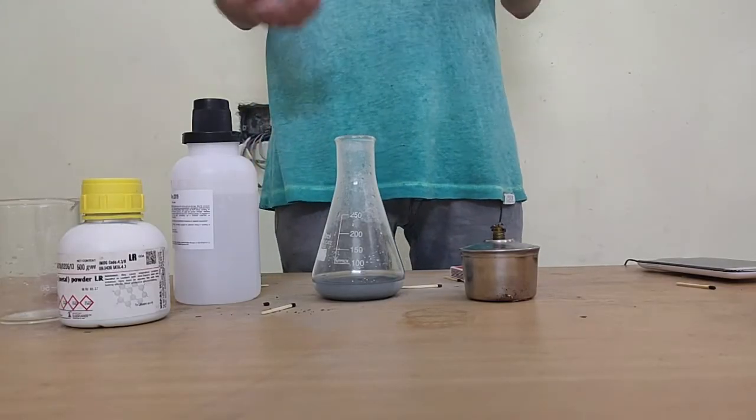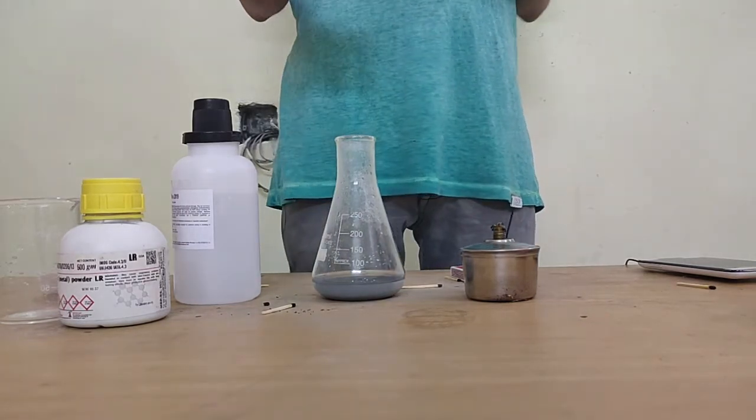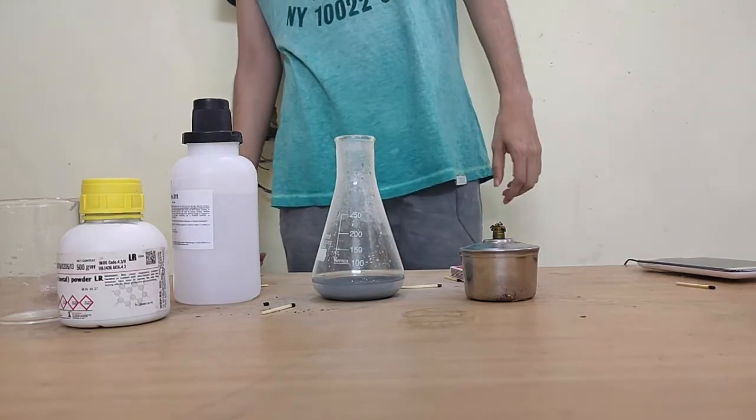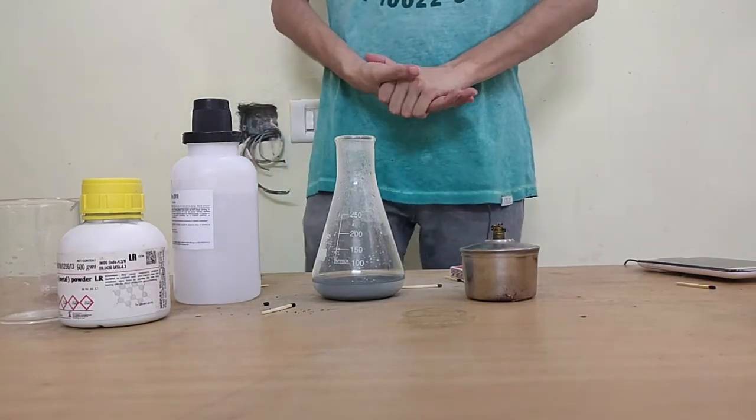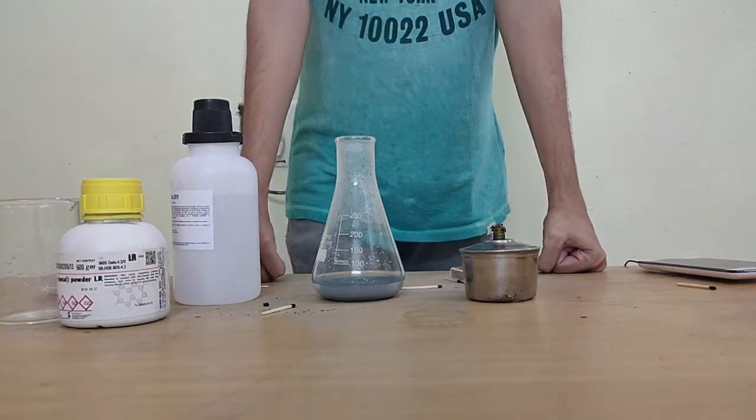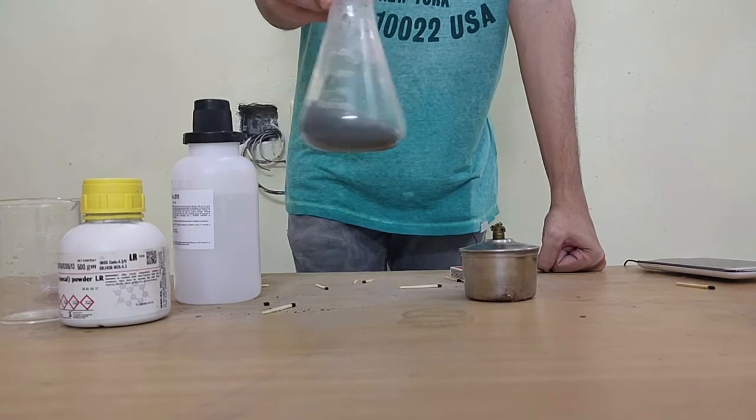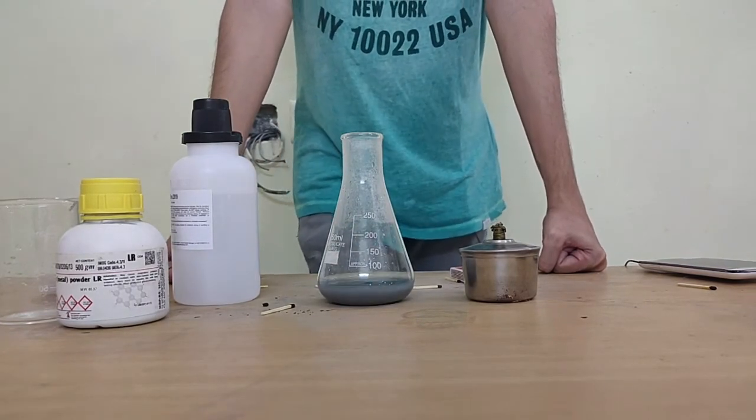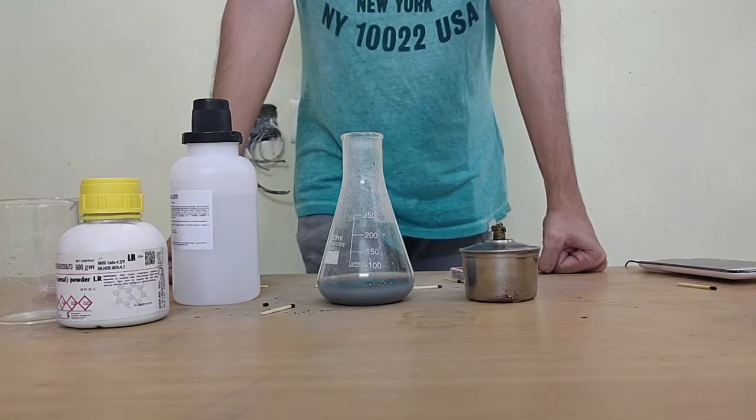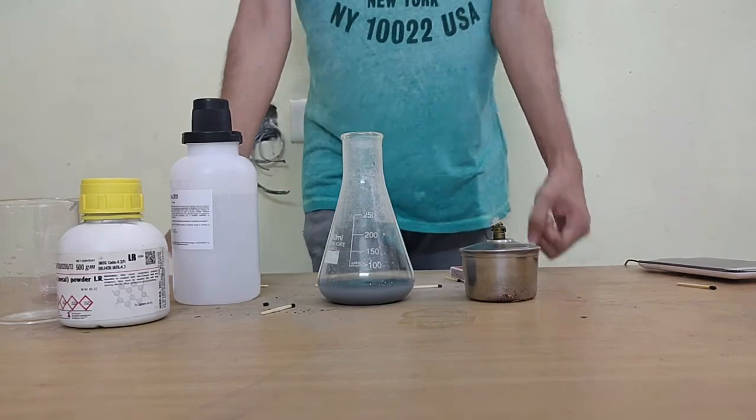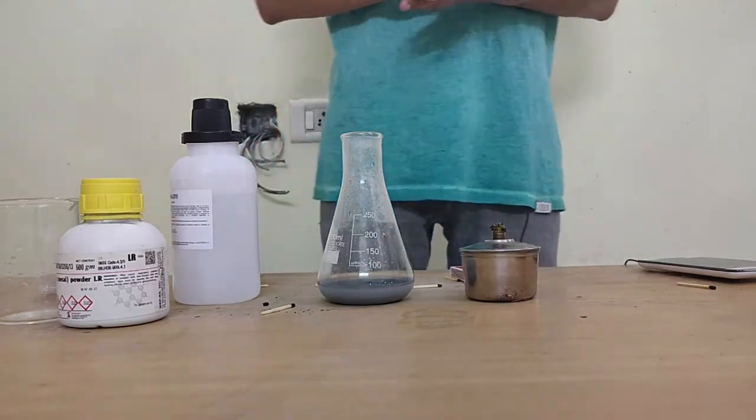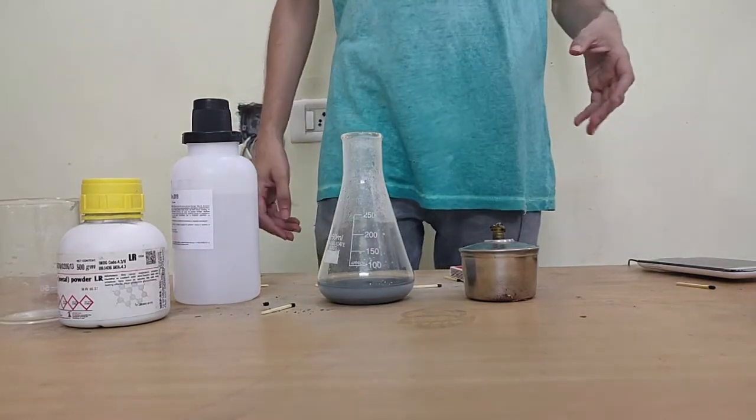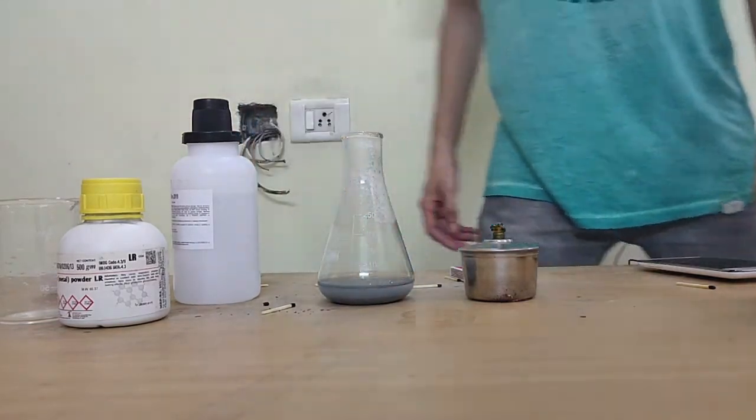Again the hydrogen gas should be bubbling and once it does bubble you'll be able to see with the pop sound test. However it's somehow not happening here so we will just stop the reaction here for today. I do hope you understood however I'm not able to figure out why the reaction is not occurring. Your observation would be that gas is produced and flame test tells that it is hydrogen gas. That's it for today, I'll see you tomorrow in the next class, thank you.